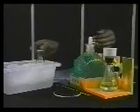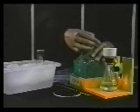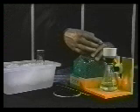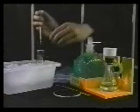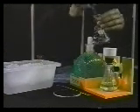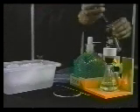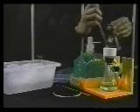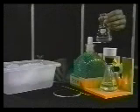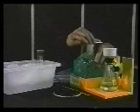When the liquid is all sucked through, release the vacuum by opening the stopcock. Wash the crystals with a little cold, clean solvent, and reapply gentle suction so that the fresh solvent passes through the crystals but a little slower.